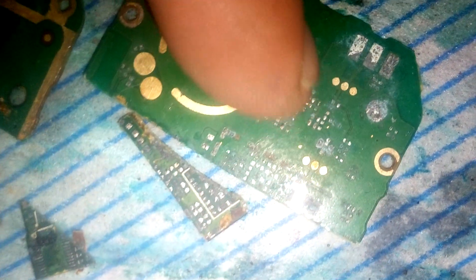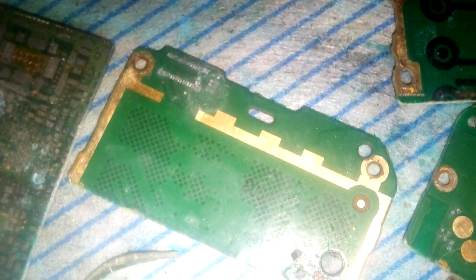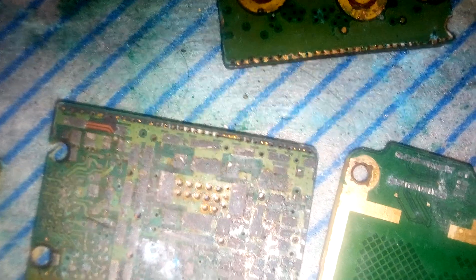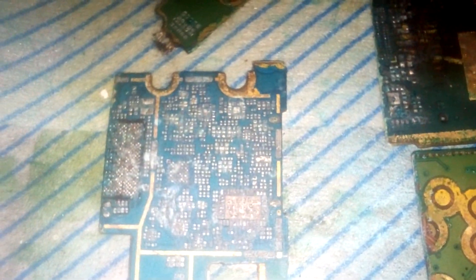But only on these little tiny parts. Some on the edge there, but not much. Some on the small circular parts. This one has been almost completely stripped — that's good. Some boards have stripped, others have not, as you can see.